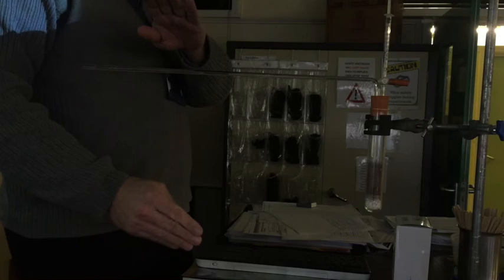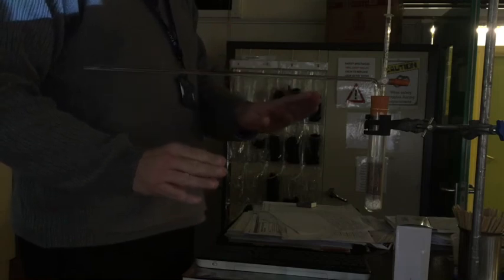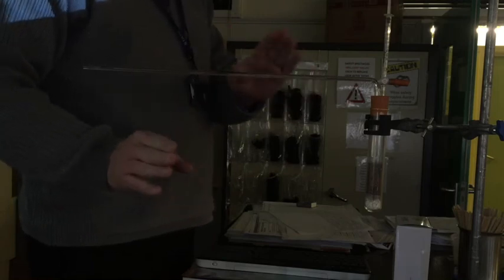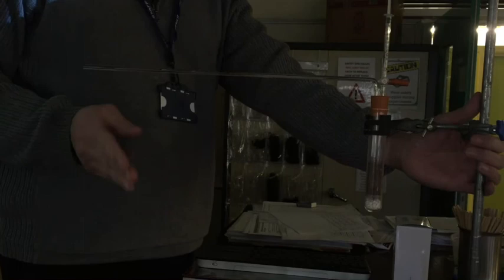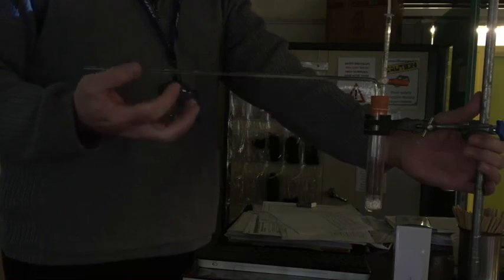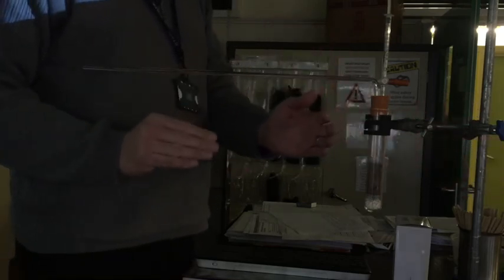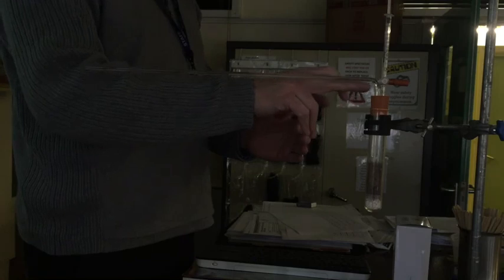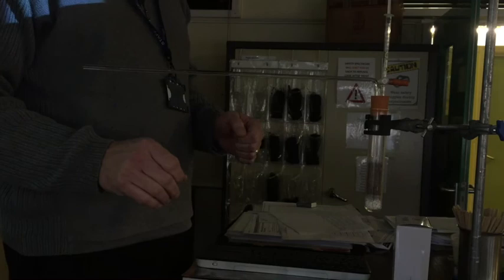We leave it for a minute. Now what's really important about this apparatus is be very careful about moving it. Once we've moved it you've got to not touch it because it's very very complicated. Secondly, when we're moving it from the sides to your benches, do it with two hands. Hold one hand on here, hold one hand here. Don't hold onto this but just support it with the back of your hand. So you don't want this to wobble because this is not particularly stable. And also you don't want this seal to break. And do it very carefully, being mindful to people around you so you don't knock it.